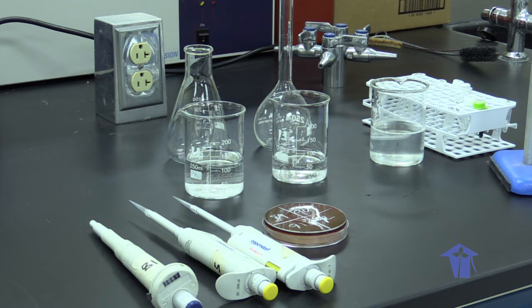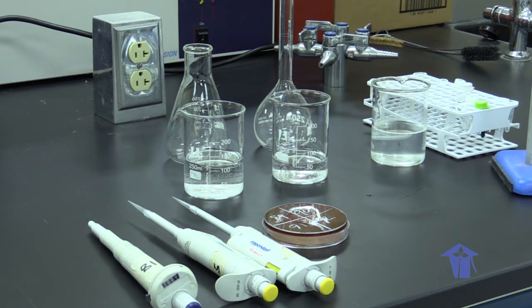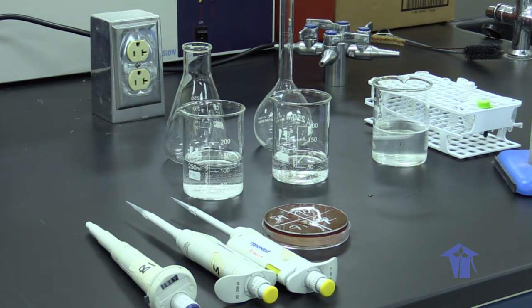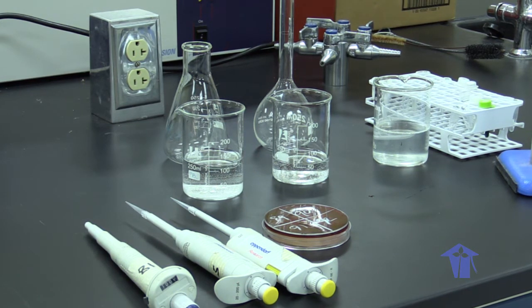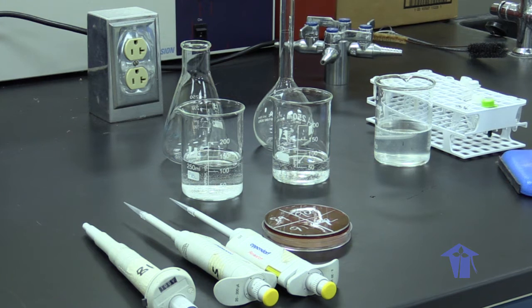So today, our materials and reagents would include, but are not limited to, our pipettes and pipette tips of various sizes, of course our cells of choice, our gram-negative bacteria. We would be also working with tris acetate EDTA buffer, which is ideal for working with DNA extractions. We would be working with lysozyme. We would be working with proteinase K. We would be working with 2% Triton.